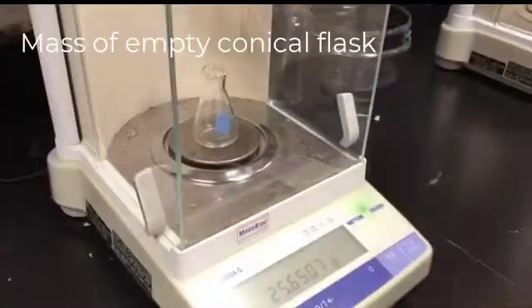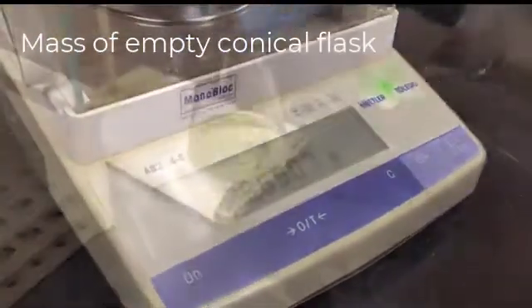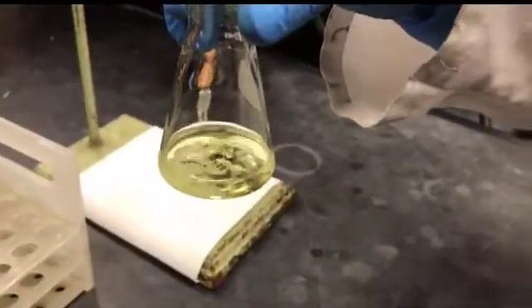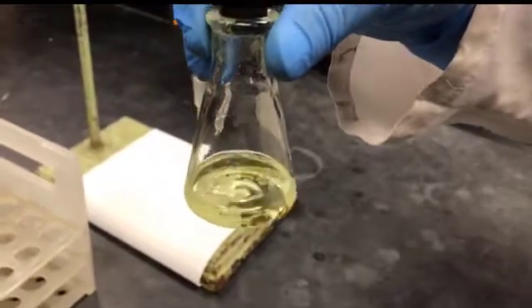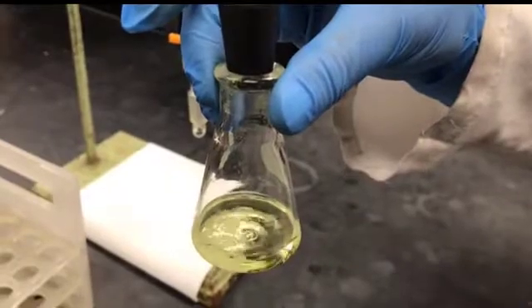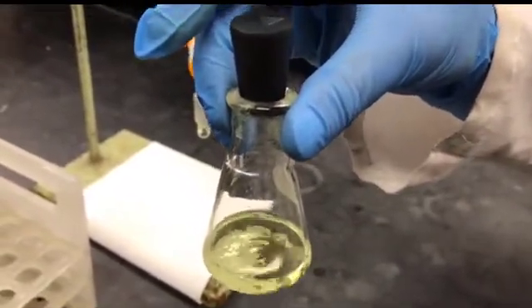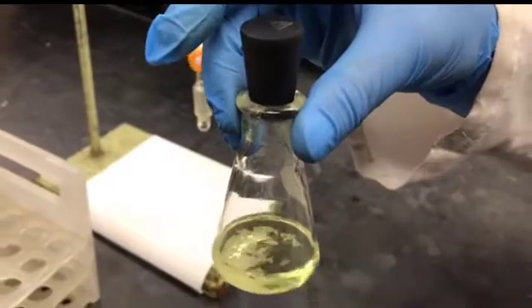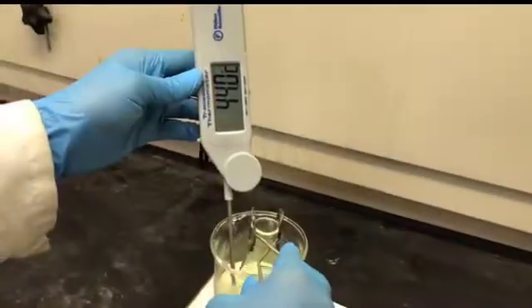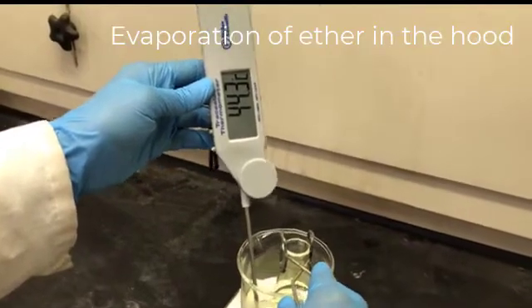This is the mass of the conical flask. It's already 15 minutes, so I'm going to transfer this dried ether layer into the pre-weighed Erlenmeyer flask, and then I will evaporate the ether to get the compound. So I'm evaporating the dried ether layer in a warm water bath.